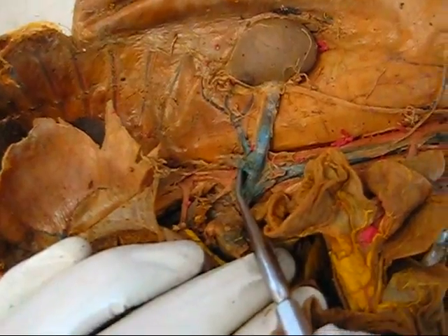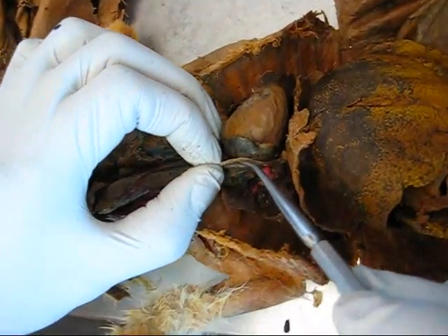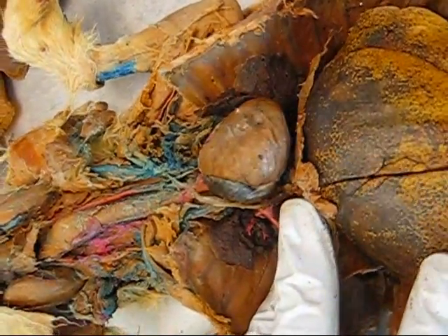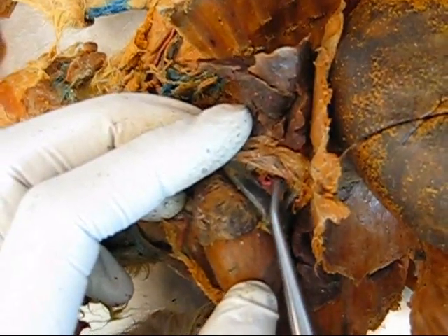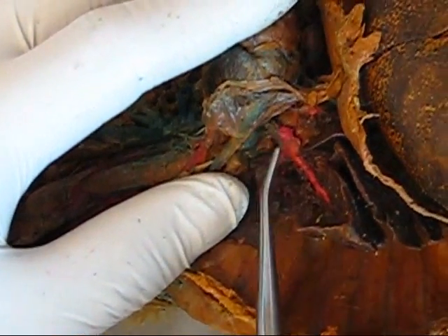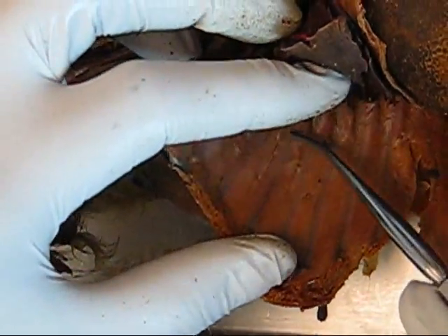Going on to the thoracic organs and neck region — circulatory system. The parietal pericardium is here, this sac around the heart. Visceral pericardium or epicardium — an indesectable membrane surrounding the heart. Pulmonary arteries begin here and enter into the lungs — they are the blue vessels. Pulmonary veins are the red vessels entering into the heart from the lungs. Intercostal arteries are the arteries that are between the ribs.